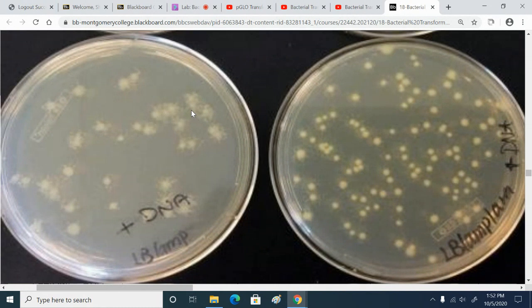Is it because the bacterial cell walls were not able to form? I don't quite understand that. I mean, the bacterial cell wall dies on the third plate by breaking out or something. Well, the ampicillin kills them, but here we have plain E. coli growing on a plate that has ampicillin in it. So how can plain E. coli grow on this plate with ampicillin, but not on the other plate with ampicillin?